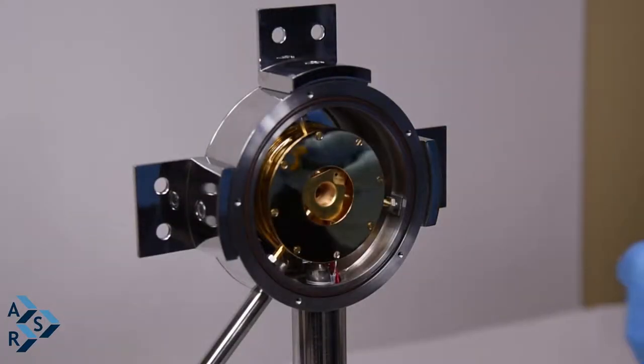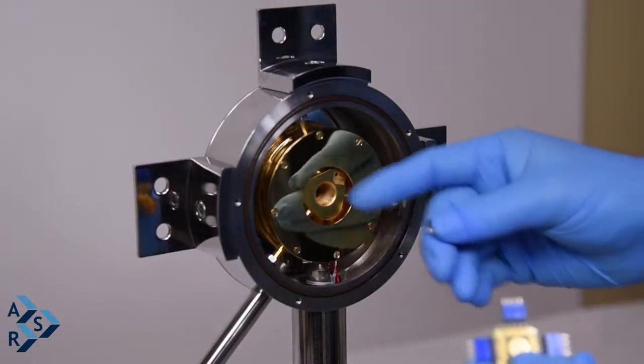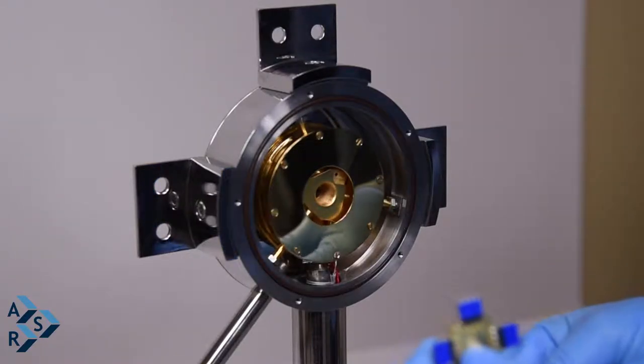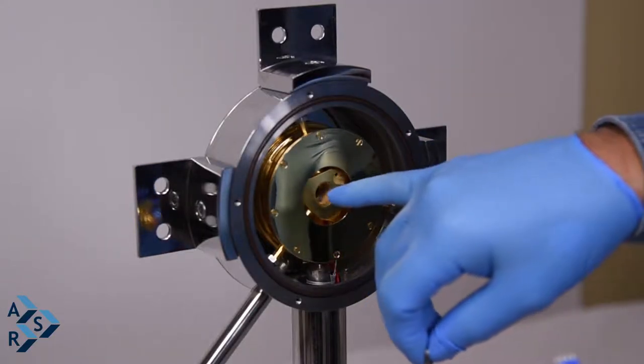Okay, we're here today. We're going to engage our sample to the bore of the LT3OM. Normally what we do is we use what we call a jam nut that goes inside the bore.